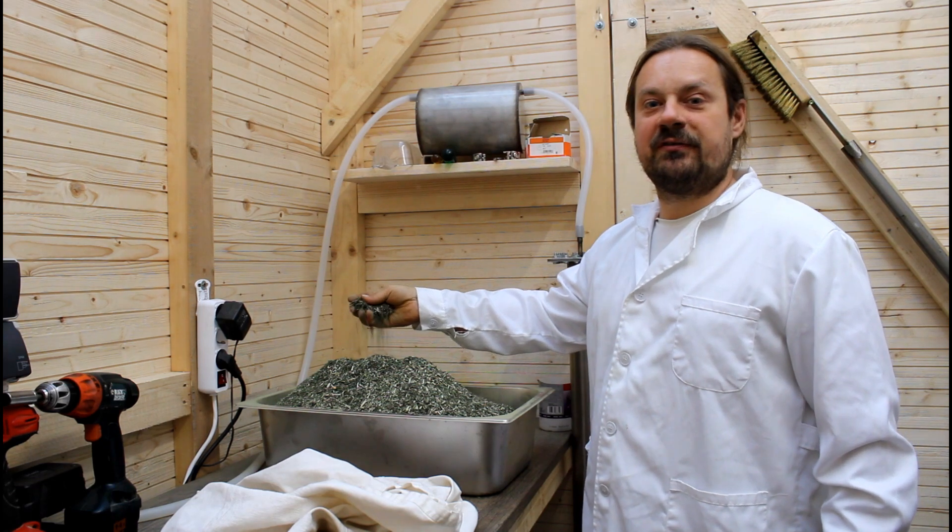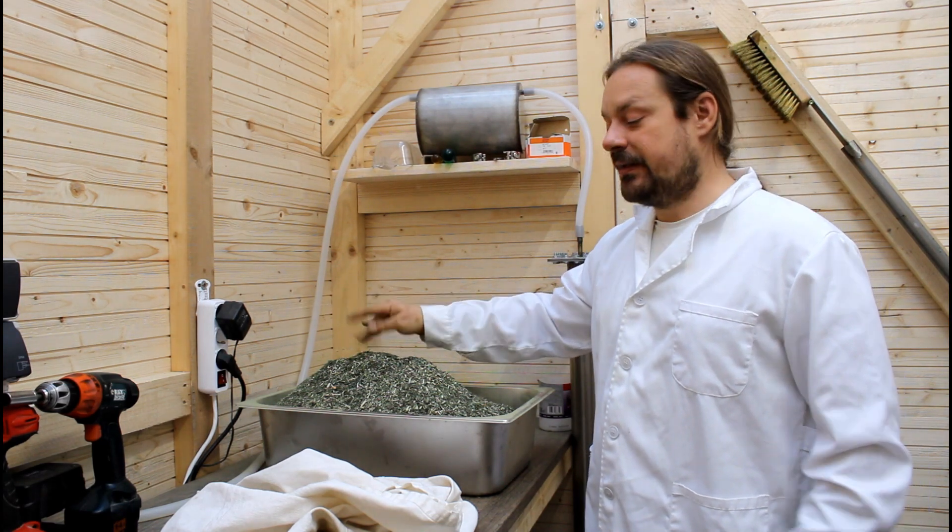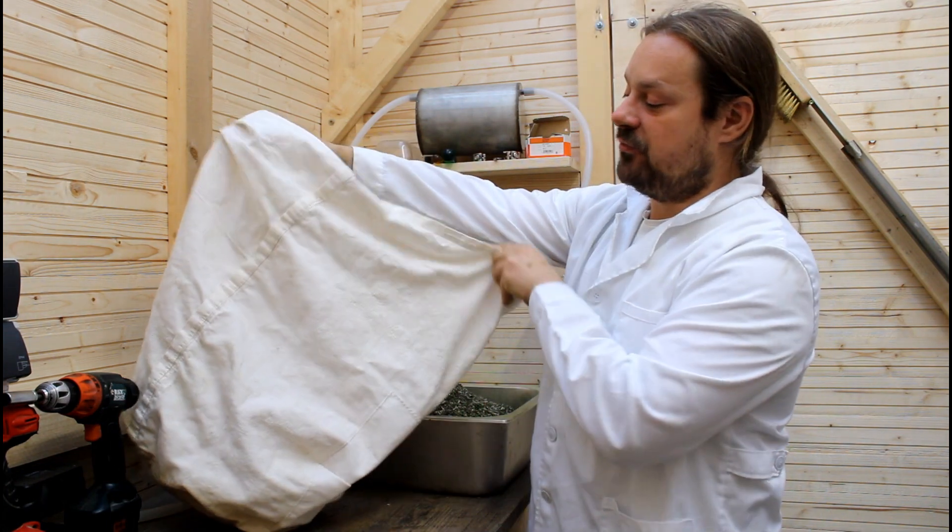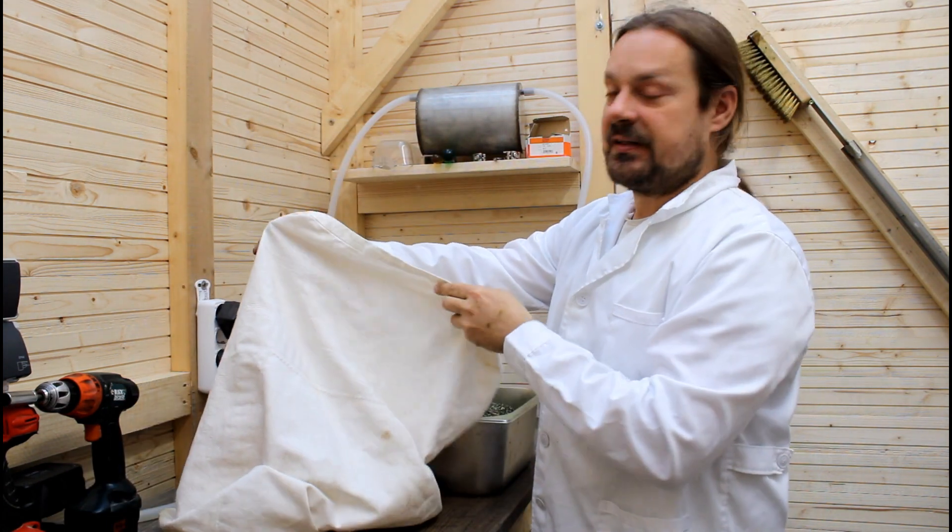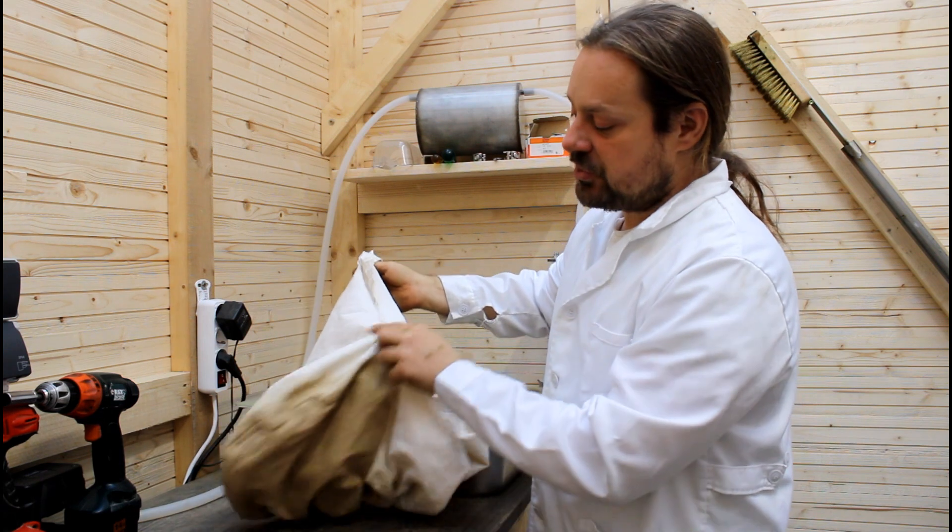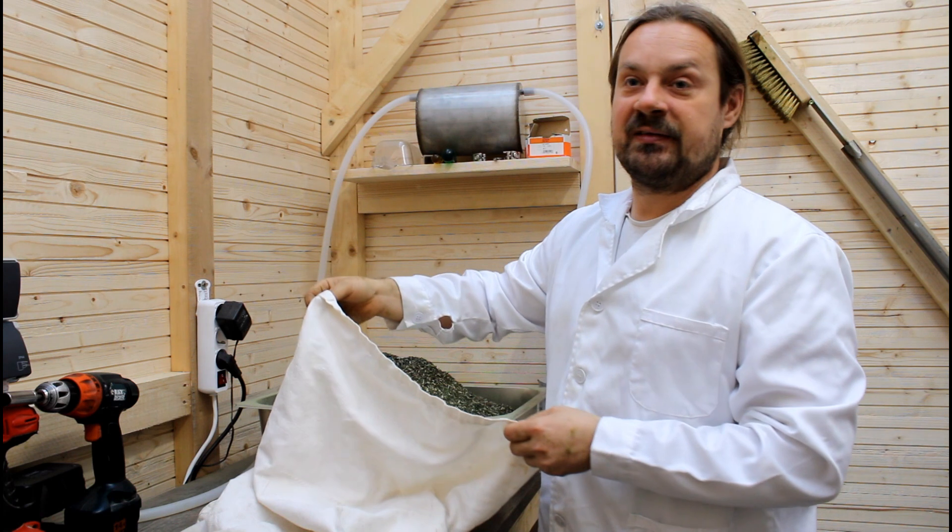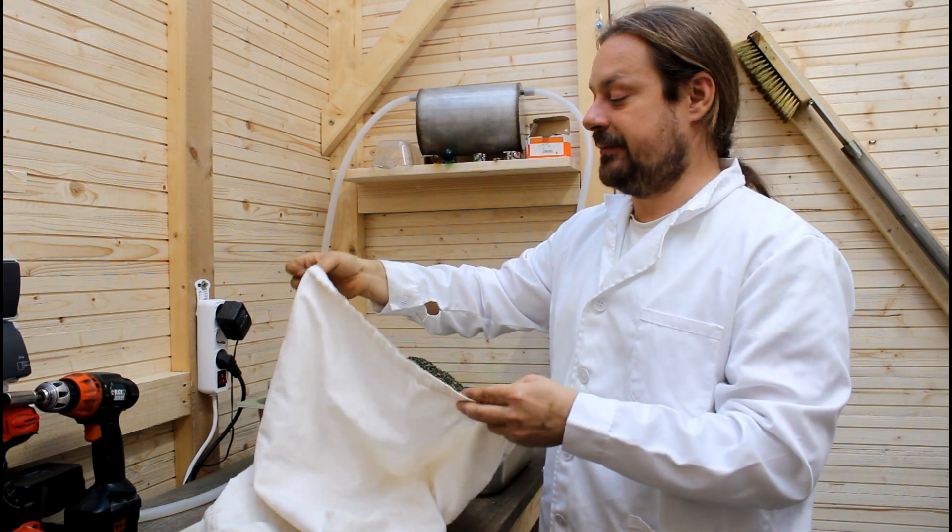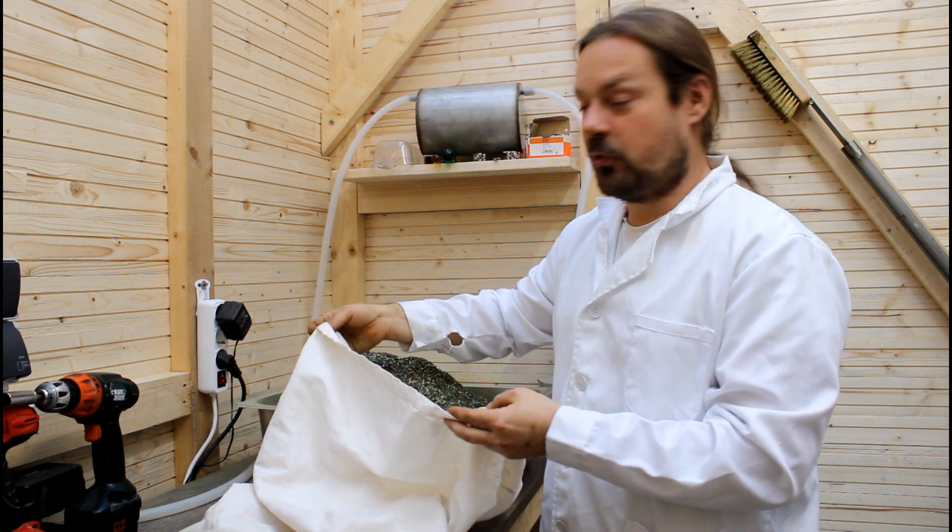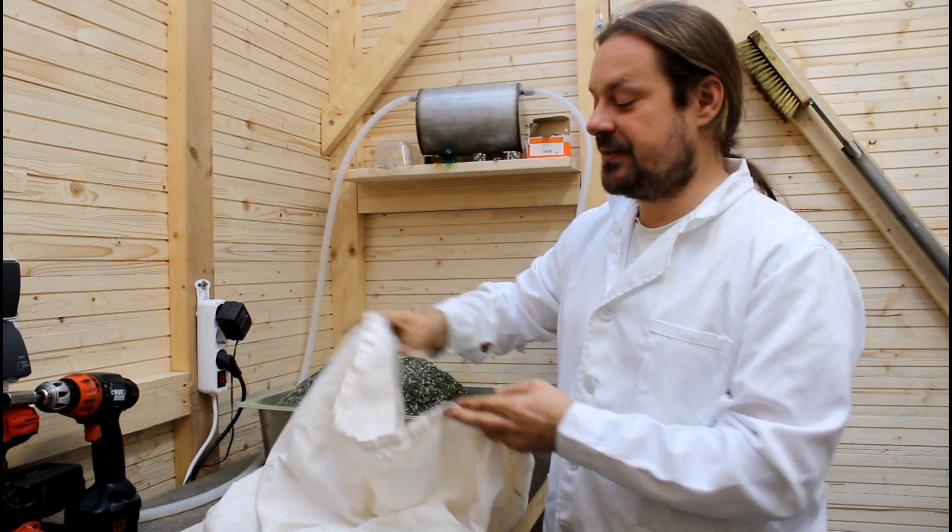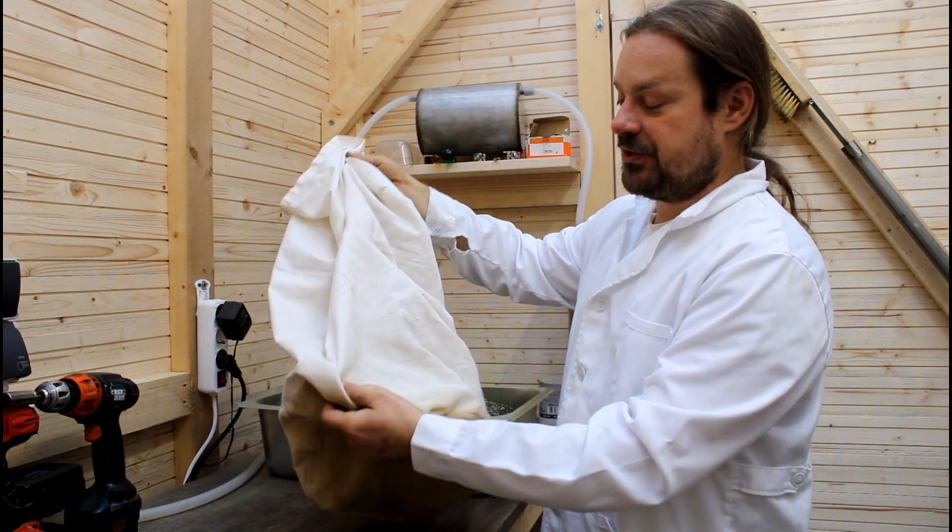Grind it down to a final particulate, we are going to fill them into these bags that I have made for extraction. They are basically cotton bags. They look somehow dirty but in actual fact they are just painted from the herbs.